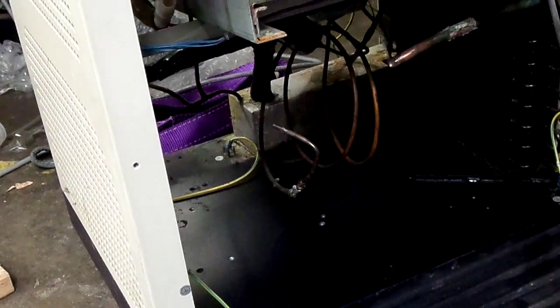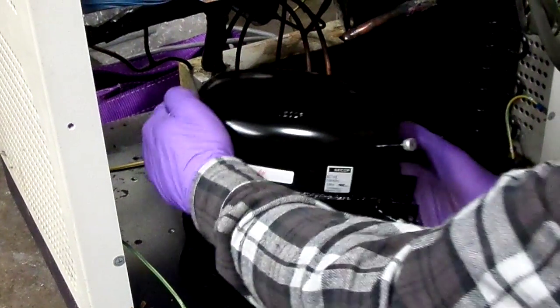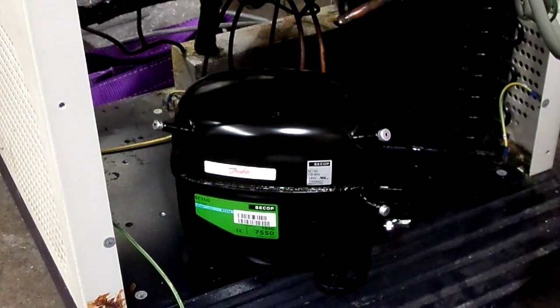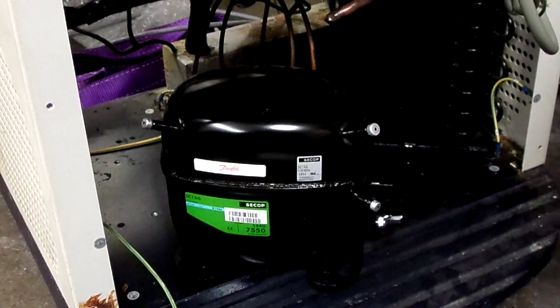So the new compressor will come with new rubber feet, a new switch, a new capacitor. It comes with everything related to said compressor.